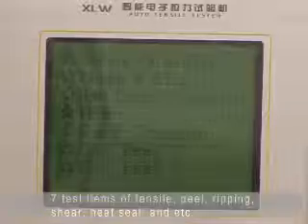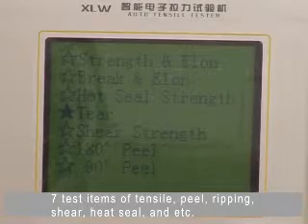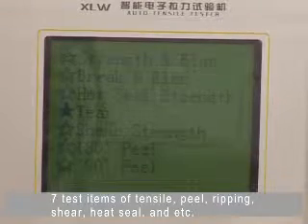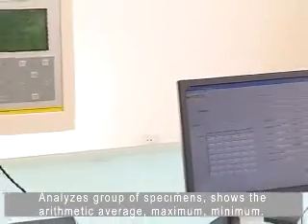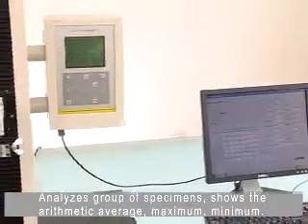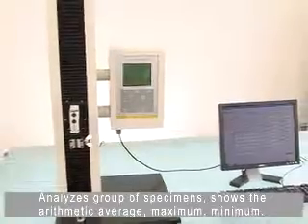The test items include tensile, peel, tearing, shear, heat seal, etc. Analysis of a group of specimens shows the arithmetic average, maximum, and minimum values.